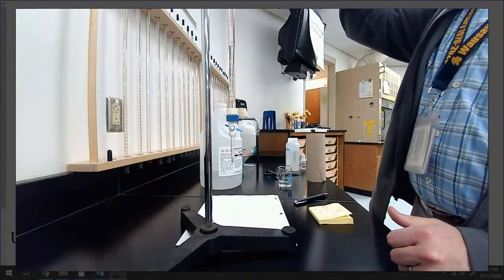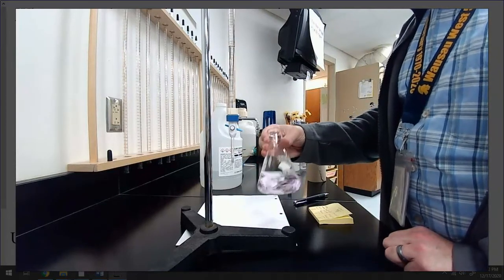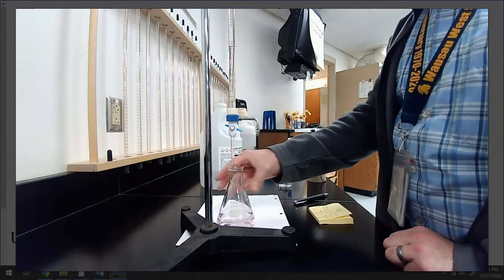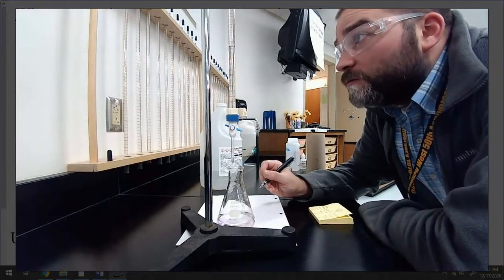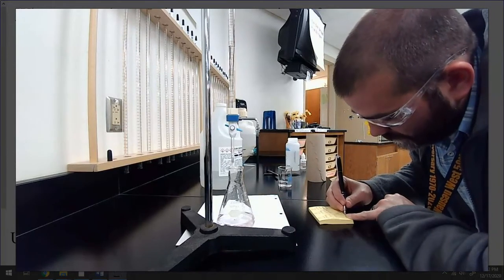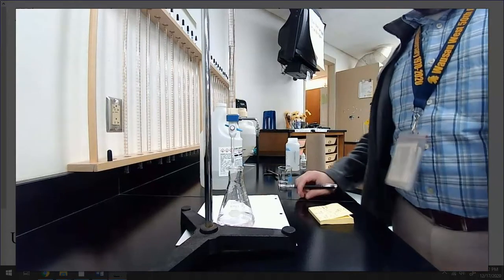Let me just make sure I don't have any solid acid in here. No, it's all gone. I think it's going to go back to colorless. It's trying. That's still pink, though. Again, you can't see it probably on your screen, but it is still pink. All right, I'm not going to add any more. My volume ending is 39.86 milliliters. Cool. So I have all the data.